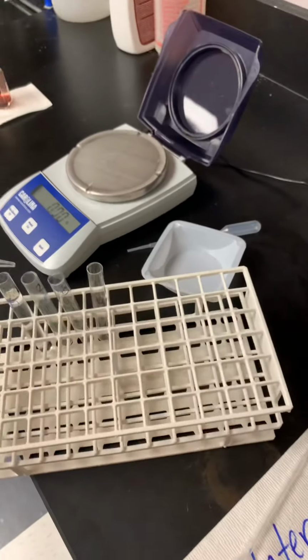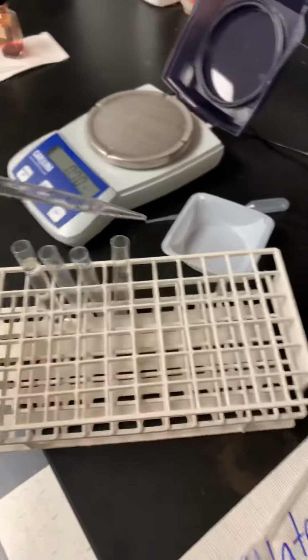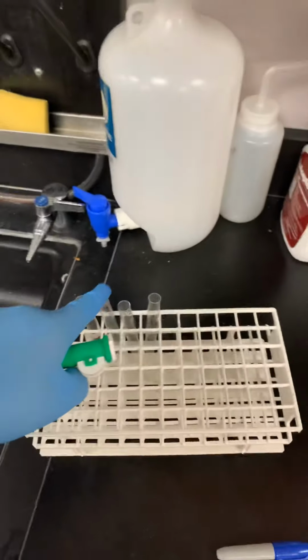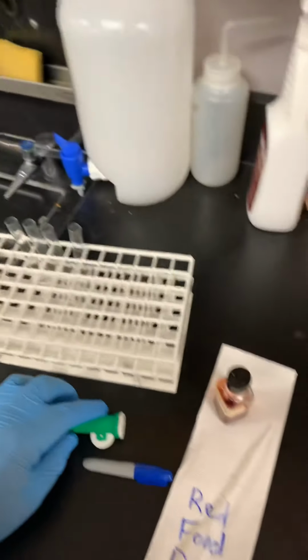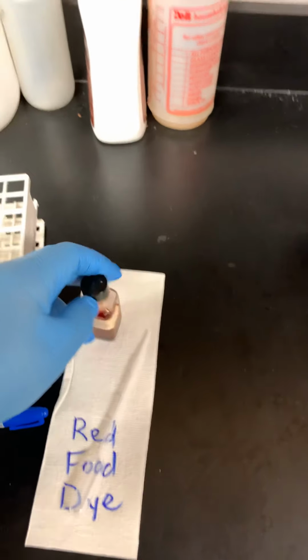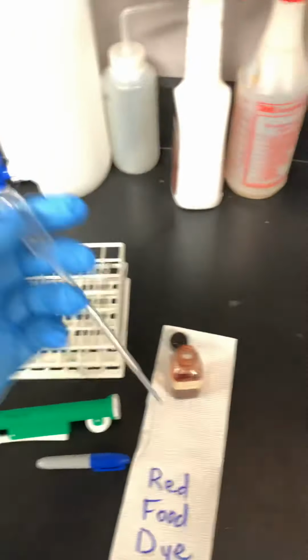You're going to do the same with 4 mils to here, 4 mils to there, 4 mils to there, and so forth. Then after you have your 8 milliliters of water in test tube 1, and then 4 and 4 and 4 in those, you're going to add 1 drop of red food coloring to your first tube. And only to your first tube. You don't add food coloring to the others.